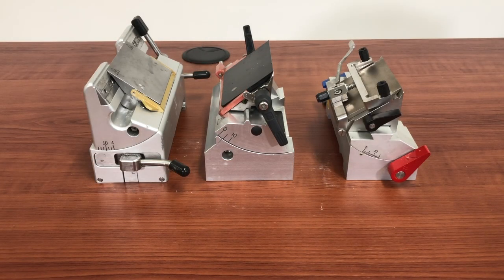The blade angles remain pretty standard from machine to machine. So for example, if you have a Microm Microtome or Cryostat, the angle's probably going to be 10 to 12. And if you have a Leica Microtome or Cryostat, the angle's going to be 3 to 5. Now before I get into any trouble with the manufacturers, let me just say this applies to most machines out there that have disposable knife holders. There are some exceptions and some awkward blade holders that don't necessarily follow these rules.